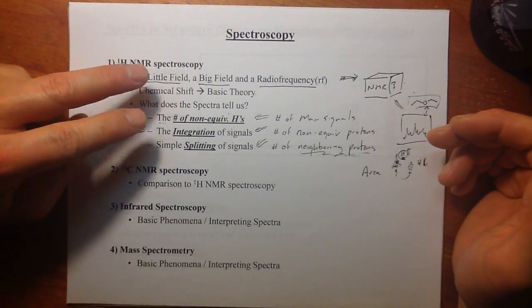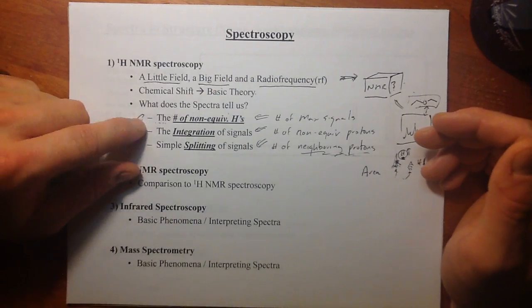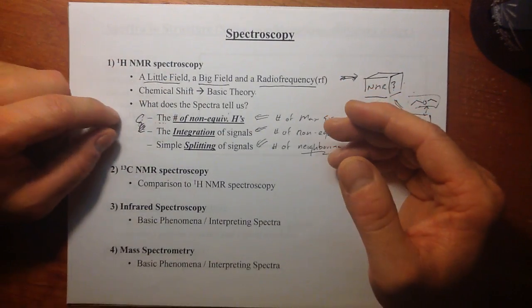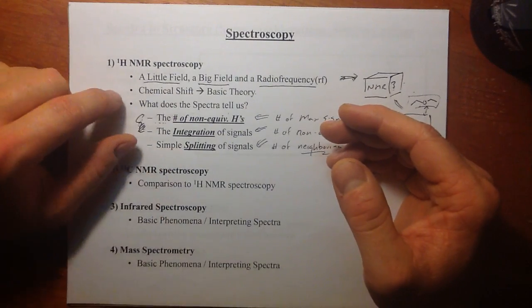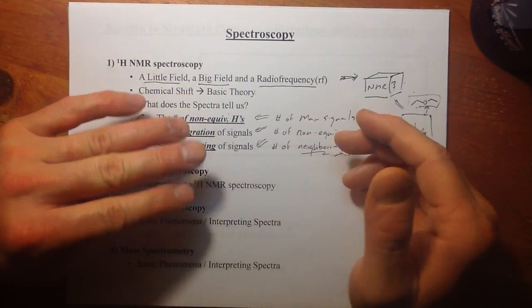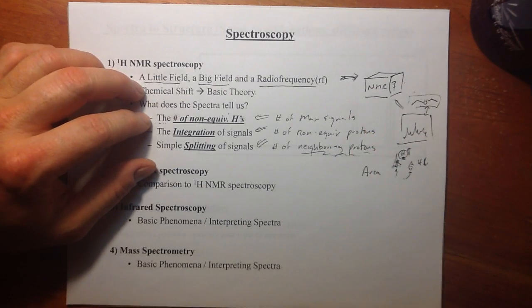And the next two videos really dealt with the structure of spectra, looking at unpacking the number and position of peaks, and how that relates to the number of non-equivalent protons. Integration and splitting was the focus in the third video on proton NMR spectroscopy. And then the fourth one here is going to take a little bit of a change in direction.